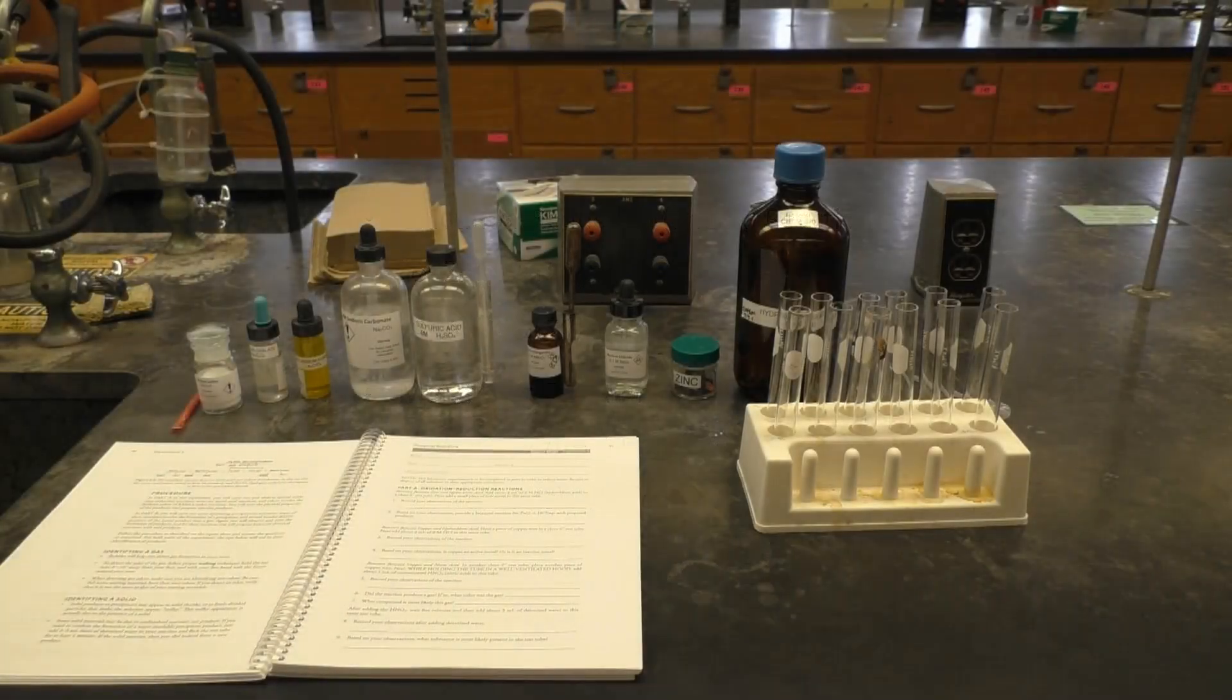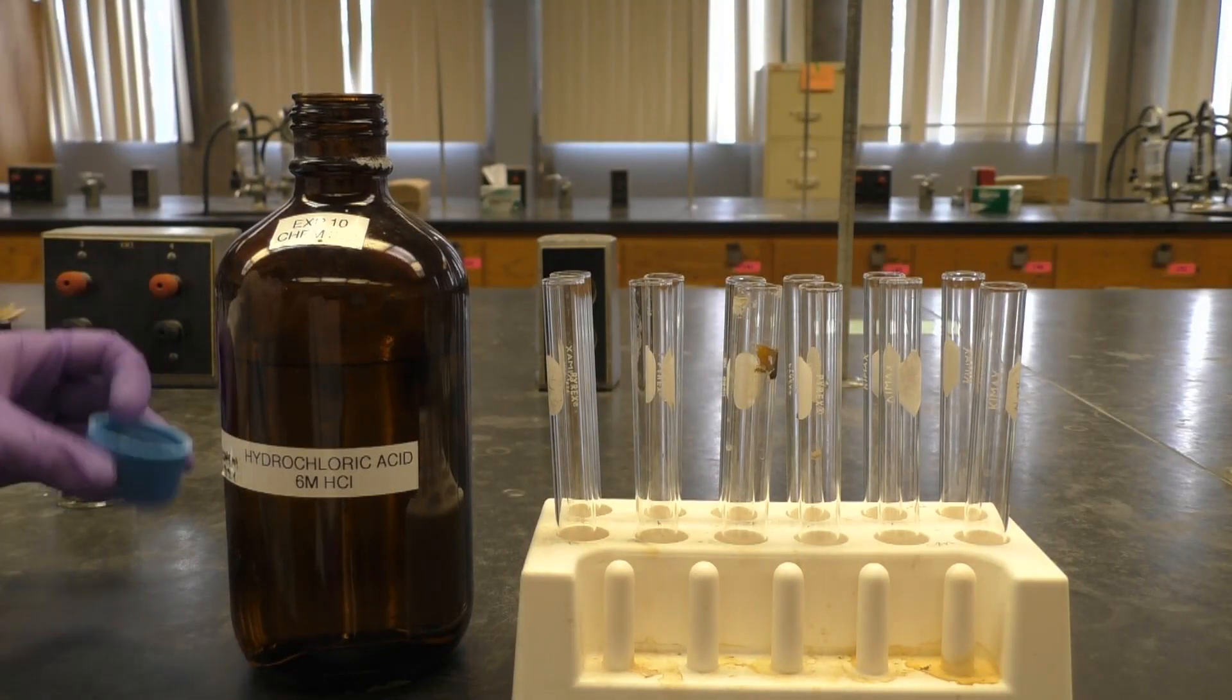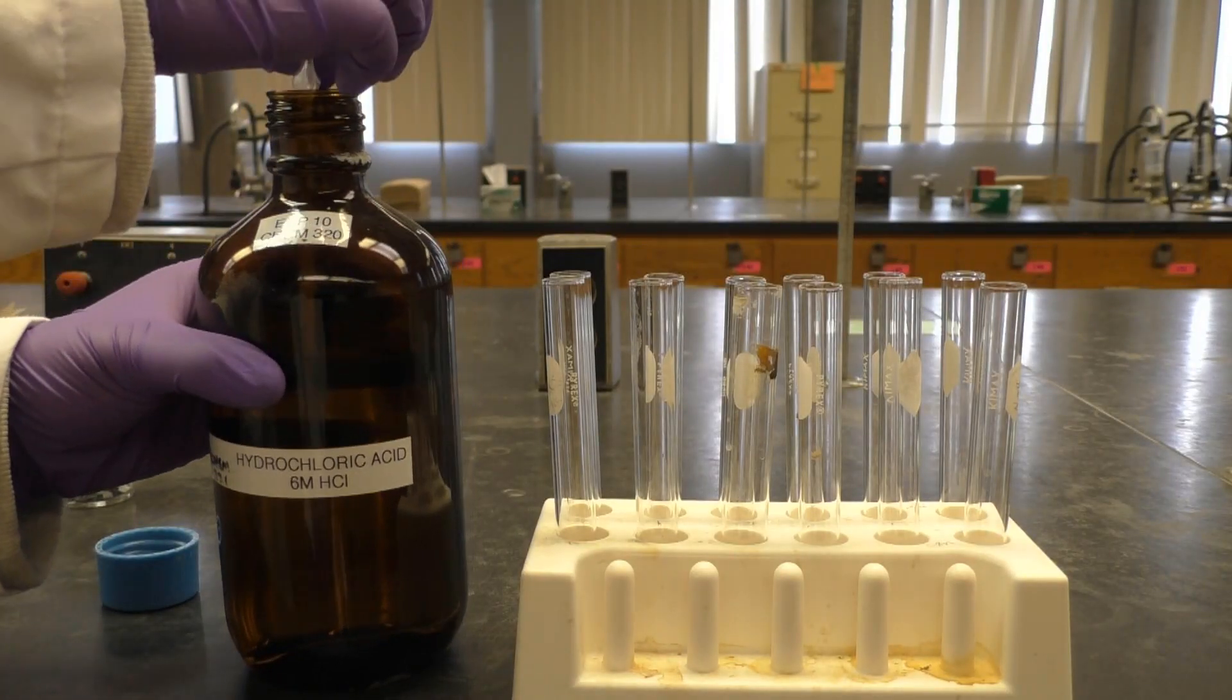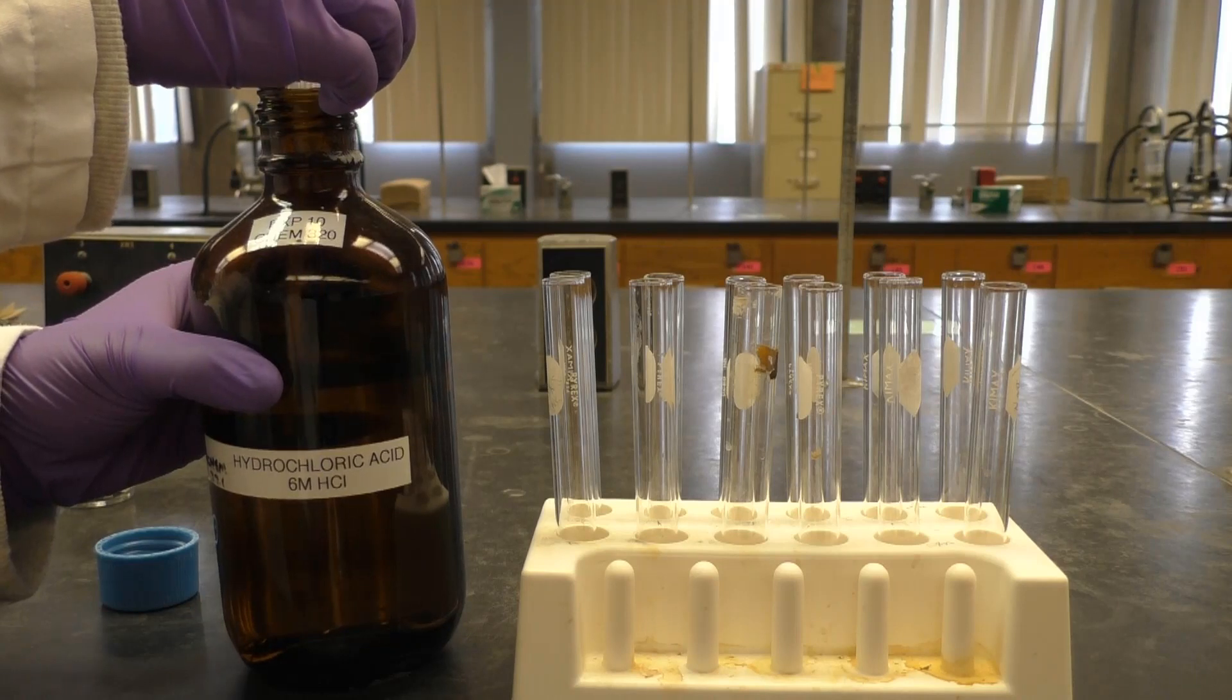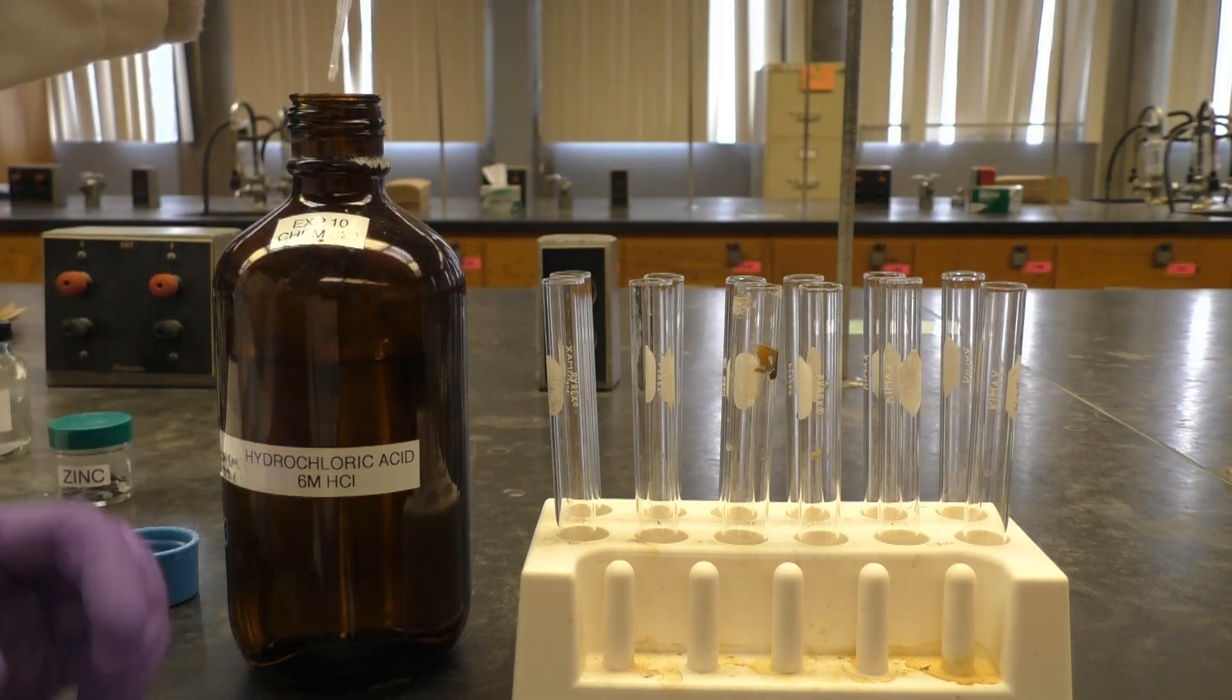For this lab you will need your six-inch test tubes from your drawer and the chemicals provided by your lab instructor. Make sure to perform each reaction done today in a clean six-inch test tube.